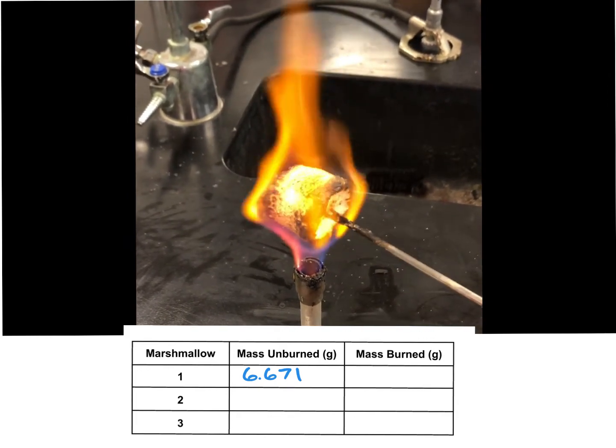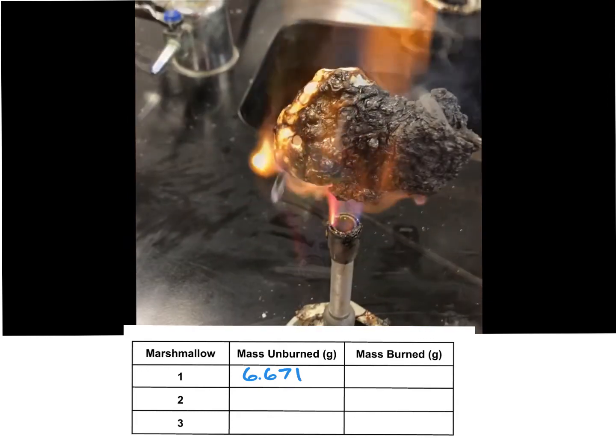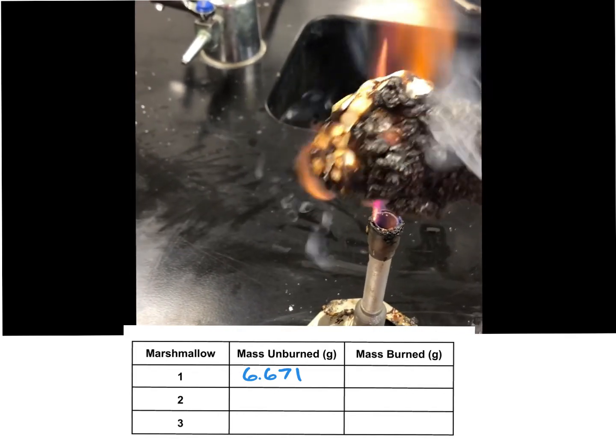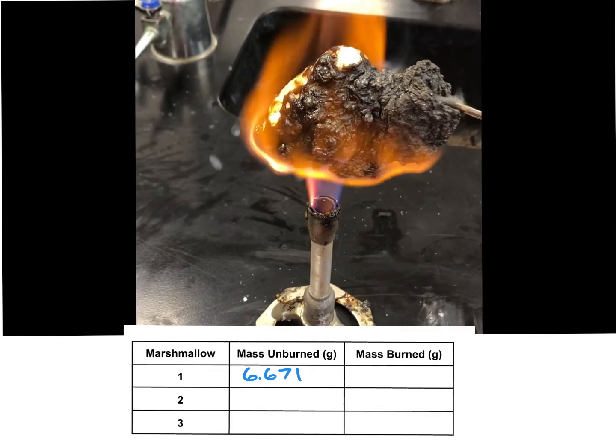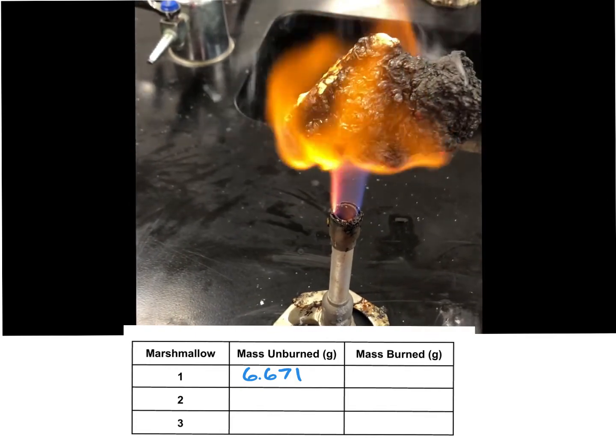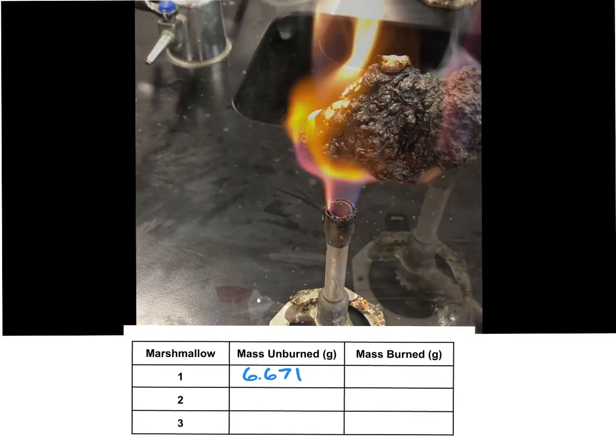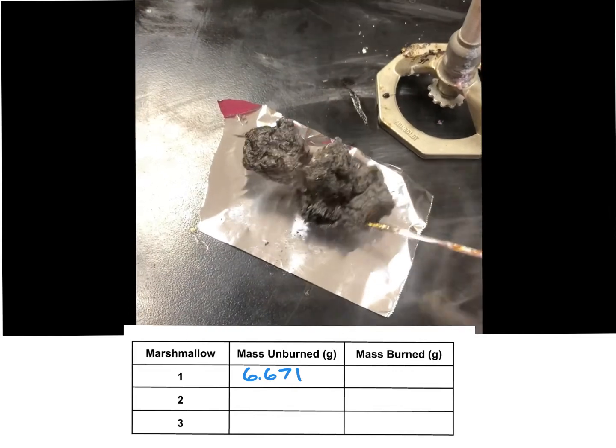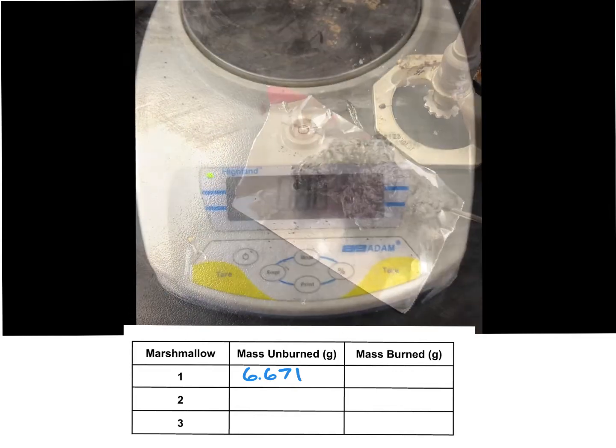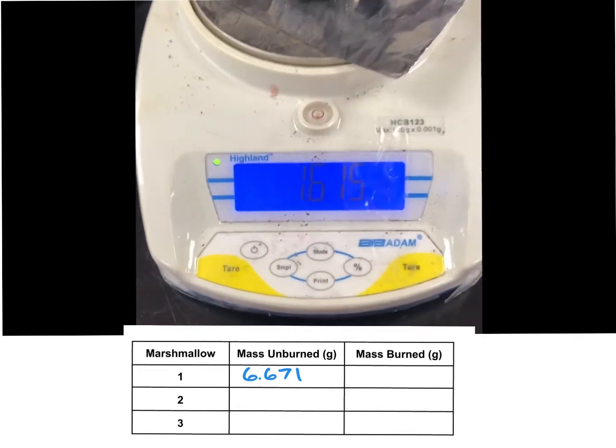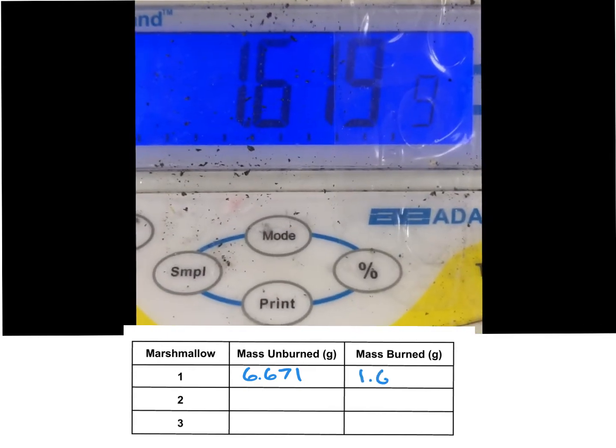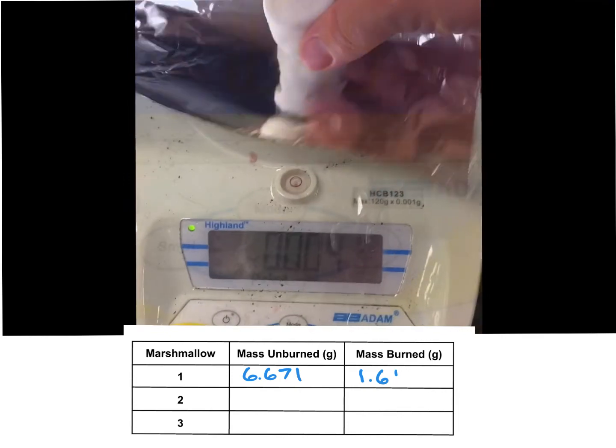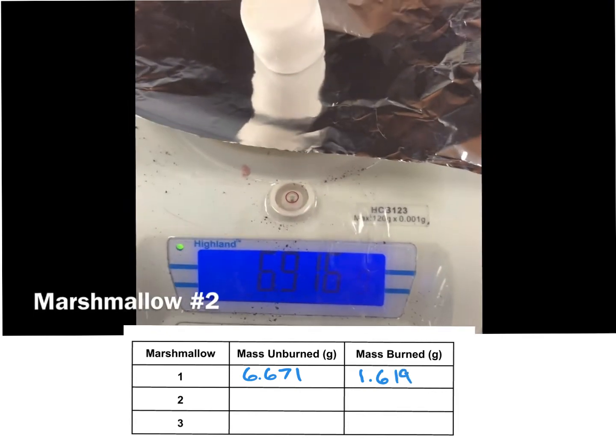Definitely not going to burn it to the point that you would want to eat it. We're going way past that. If you try to eat this thing, that's just a health hazard. That's like a carcinogen. That's nothing but not good for you. If you do like your marshmallows this burnt, there's something wrong with you. Don't eat it. So my final after it's burnt is 1.619. Going on to number two.